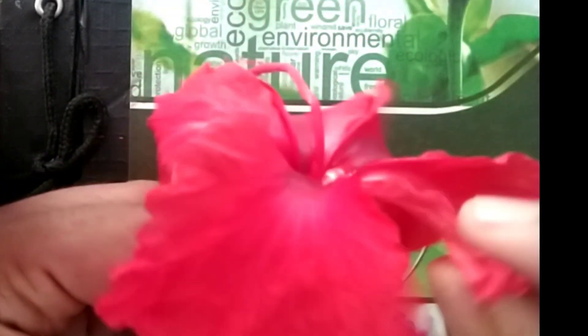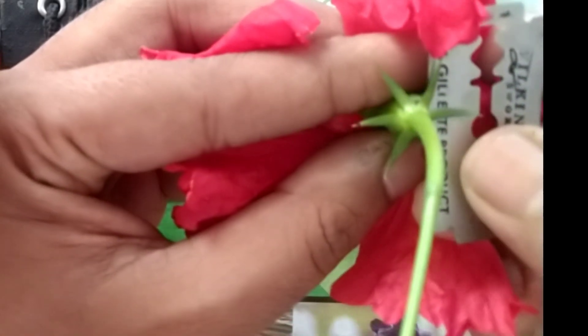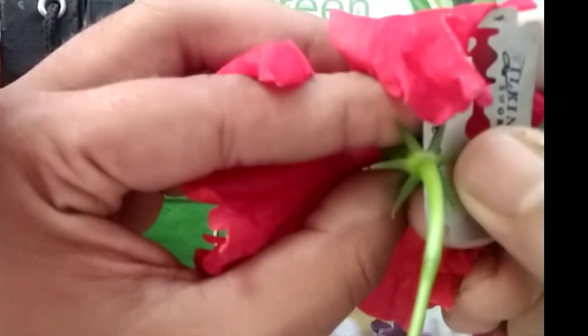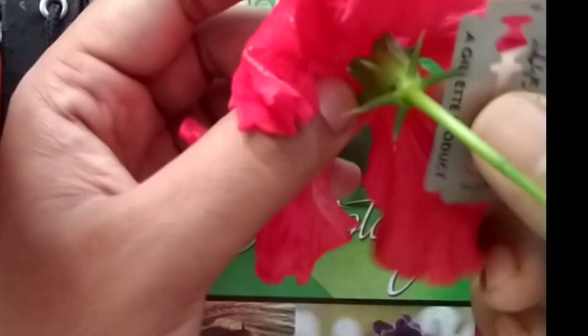Here you can see the Hibiscus flower — I am using a red flower. Five petals are present. You can see the pollen grains. We have to start from the separation of the epicalyx. I am using a blade to separate the epicalyx from the flower. You have to carefully remove the epicalyx. Care should be taken while dissecting the flower.